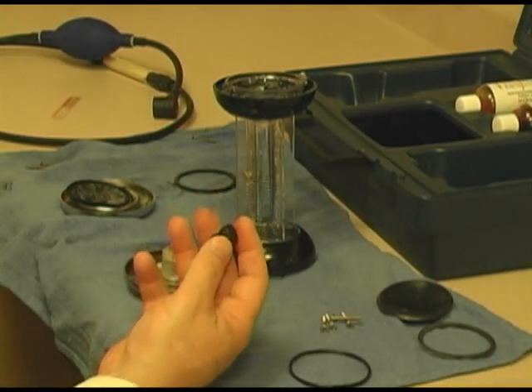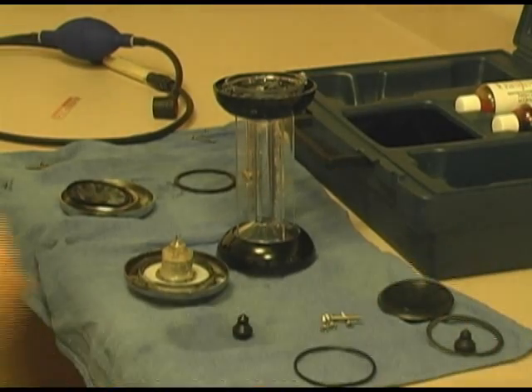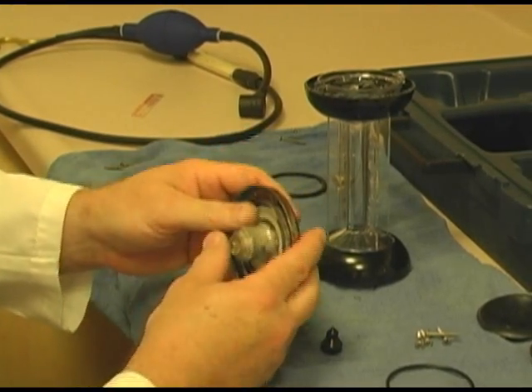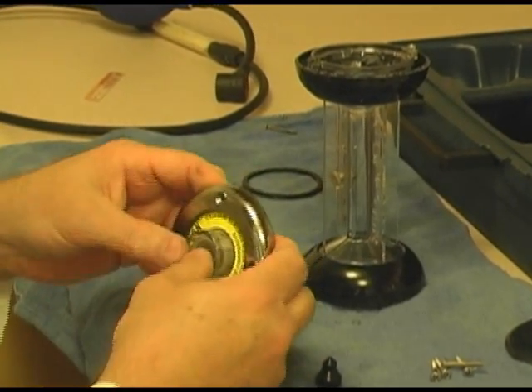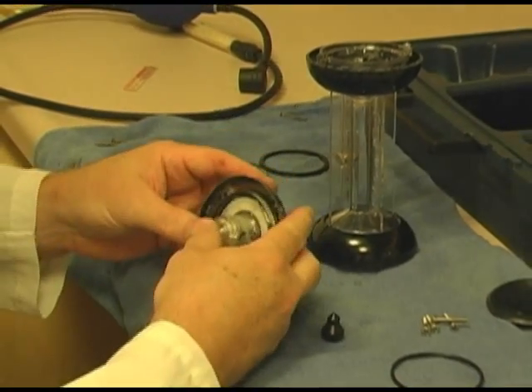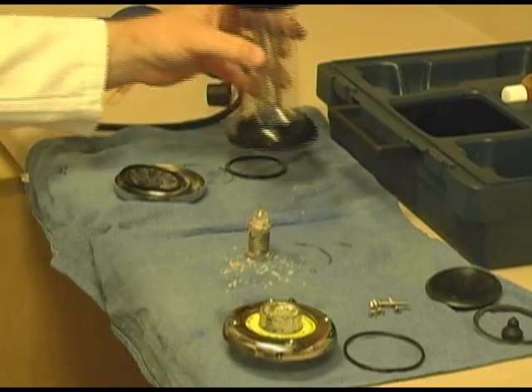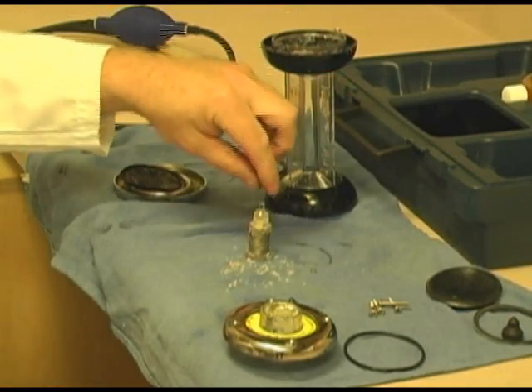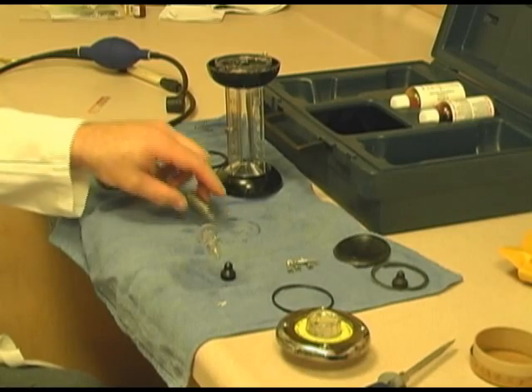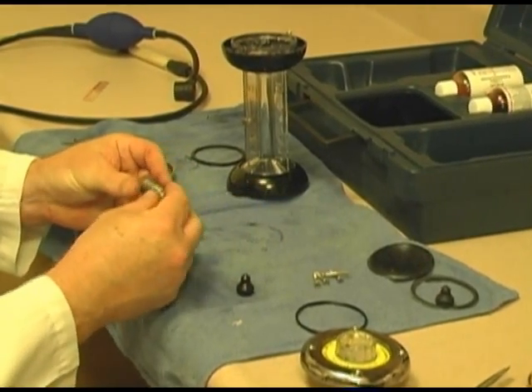Okay, and of course you have the new one that goes on it. And I'm going to wipe this down a little. And we want to make sure that this is still sticking. So we're going to pop that out. Why doesn't it want to come out? This is a little tight one. That's what you get for there. Now we can see what happens. All this salt material. And give me a second, we're going to clean this off. Now we've cleaned this off a little, you can see the salt is gone, and you see the spring. This is what, of course, allows it to pop in and off.